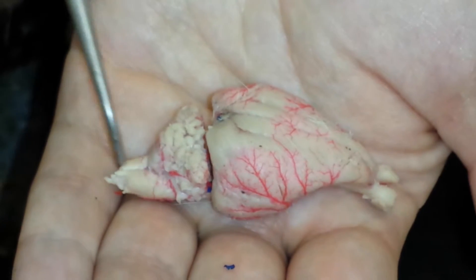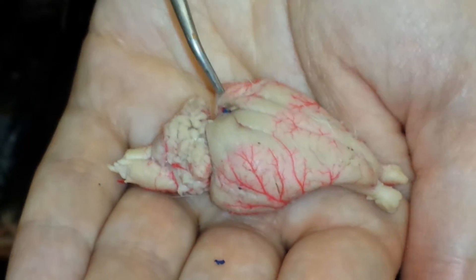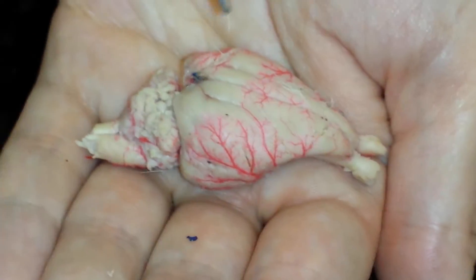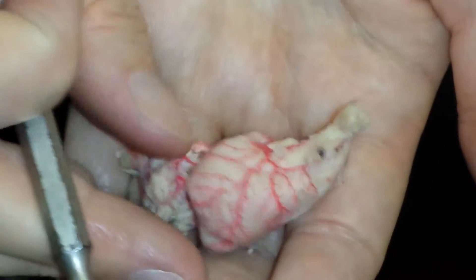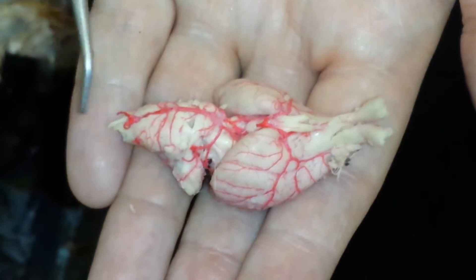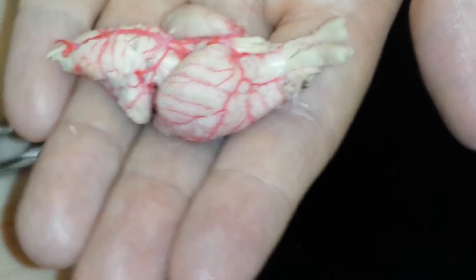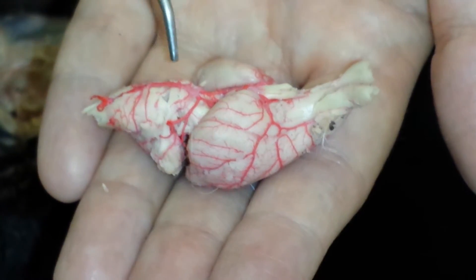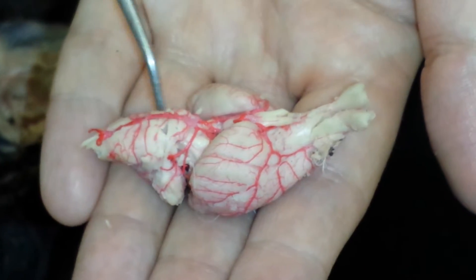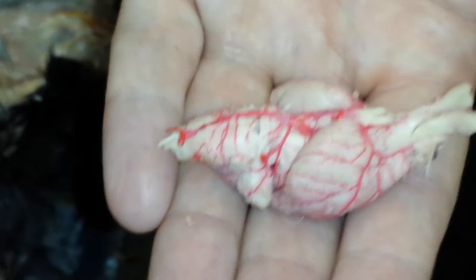You can also see the medulla really sticking out down here. The pineal body is in here, right here. The longitudinal fissure is what separates the left and right hemispheres of the cerebrum. Turning it over, you can see this artery — which I think is the basilar artery — running right along this fissure on the ventral surface. This is the mid-ventral fissure, running along the medulla right along the midline. And that's pretty much everything for the brain, for the rabbit.